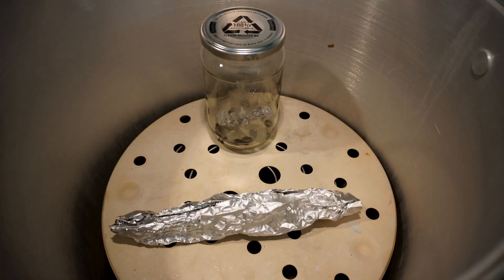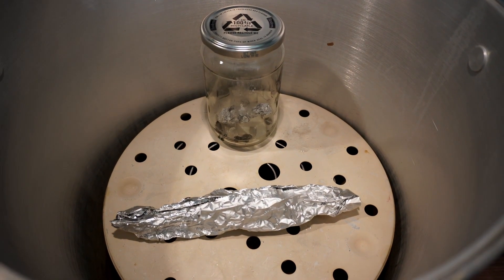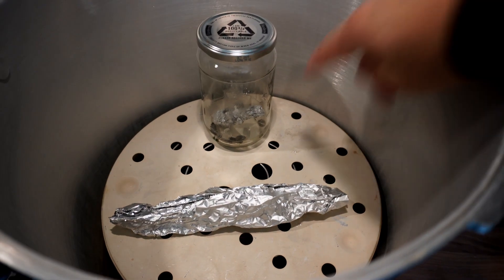Put it in a glass jar, sterilize it. If it melts it's melted inside the jar and you can just throw the jar away.